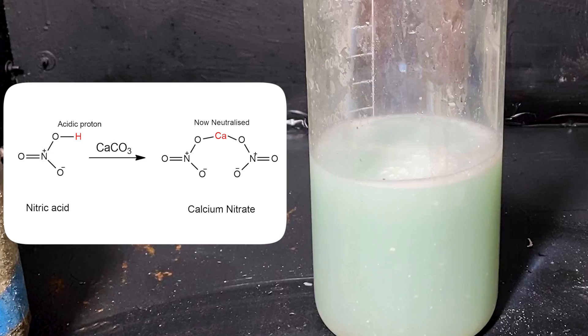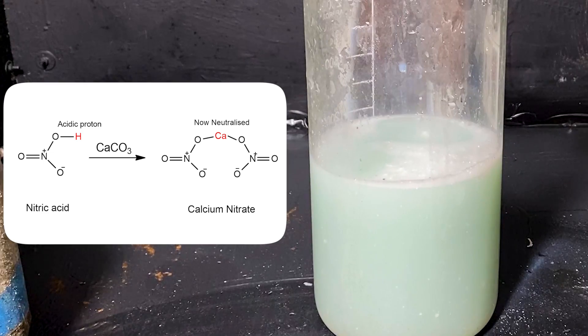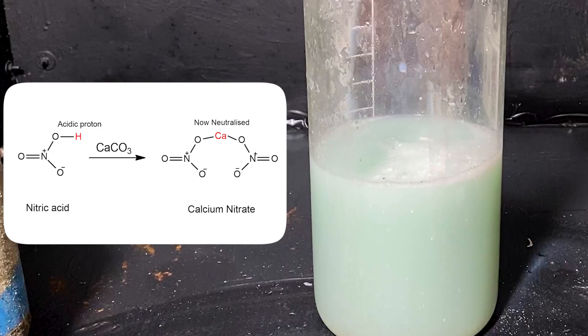That's why I've used calcium carbonate. Even though it neutralizes the acid, it doesn't dissolve into water, which doesn't tinker with the pH of the solution.